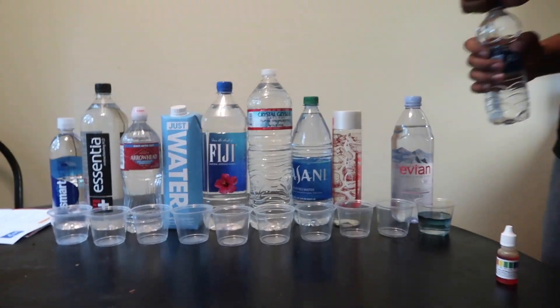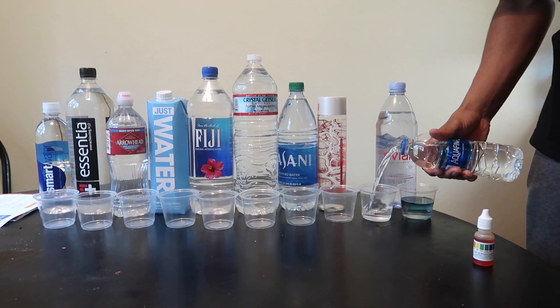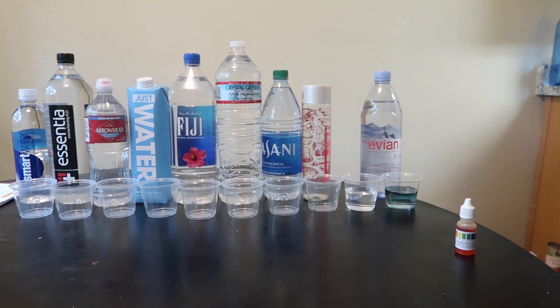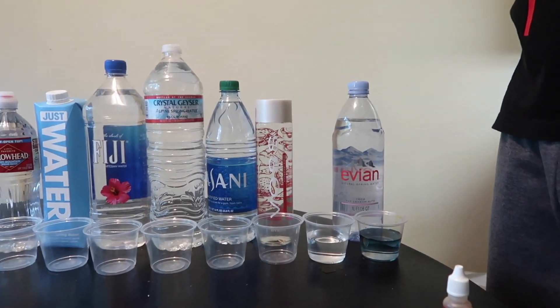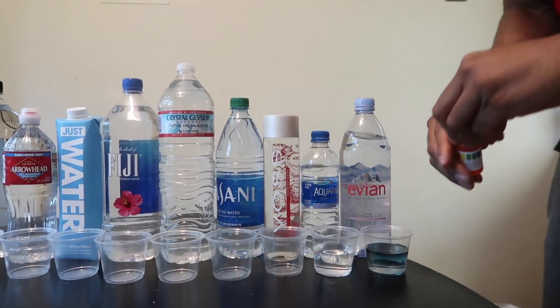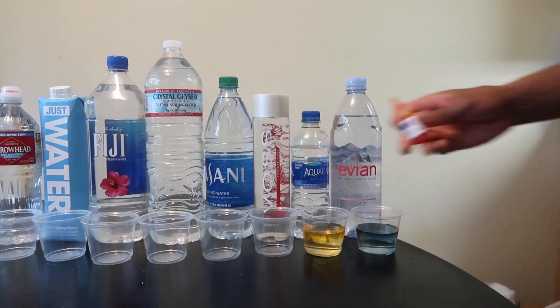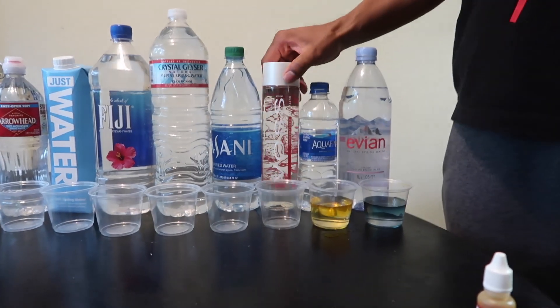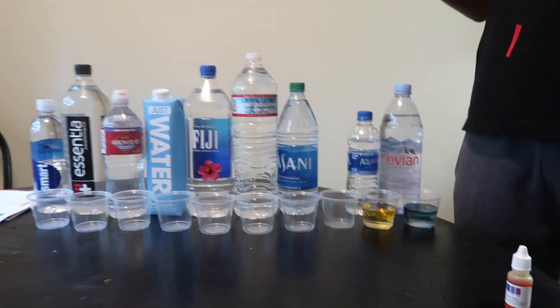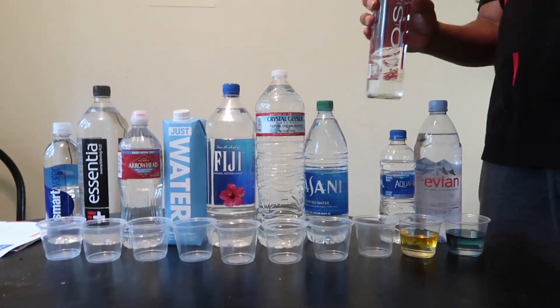Now we got the Aquafina. I don't drink Aquafina — I think Pepsi makes Aquafina or something. Oh that's bad, that's not good. Yellow — look like pee. Well of course, if it's made by Pepsi and stuff.